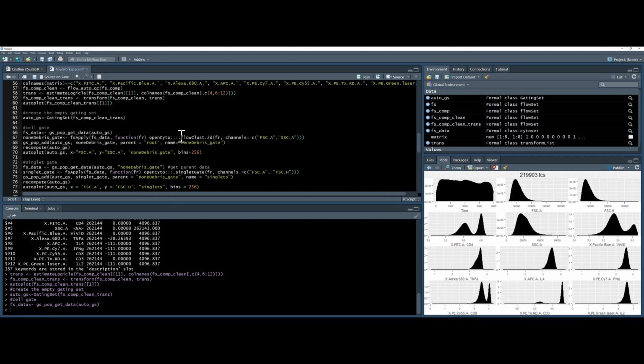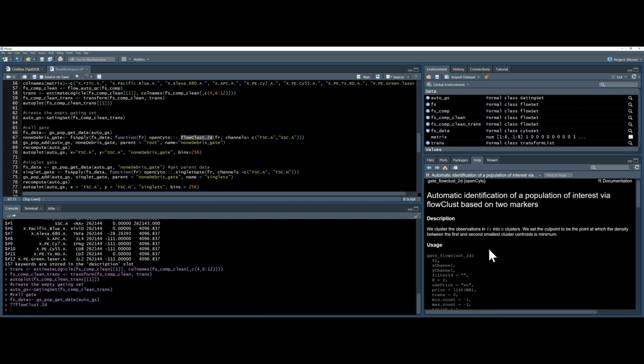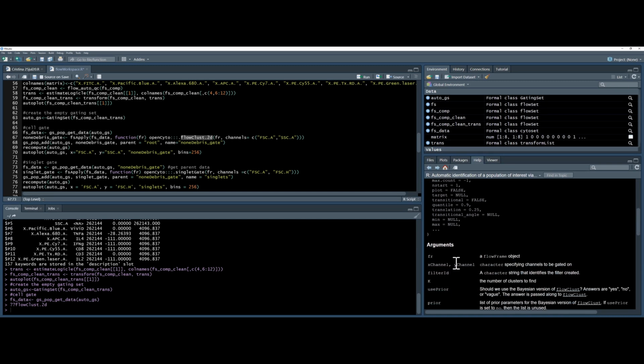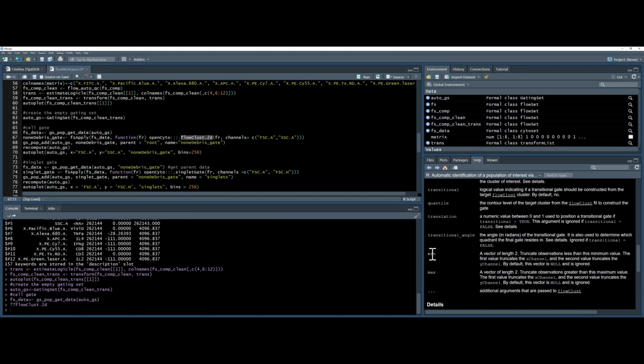So on this flowClust2D, there's lots of auxiliary commands, and as usual, if you ever want to find out other commands to add to it, use ??flowClust.2d, and then it'll give you a list of possible variables or arguments. And if you ever have any issues, you read through this and find out if you should change any. And quite often, you'll find you want to maybe add a min. If you have a lot of debris, you can tell it to only look at cells over a certain level. But anyway, we're going to trust it and we're just going to go for it.